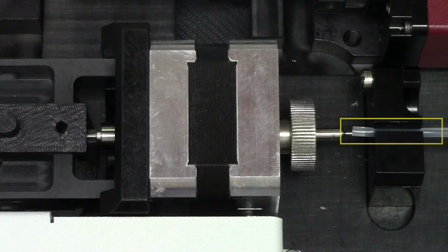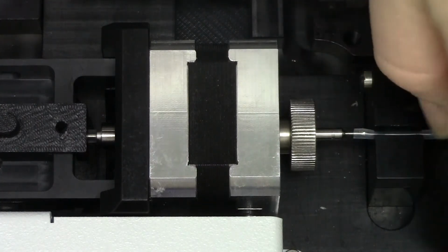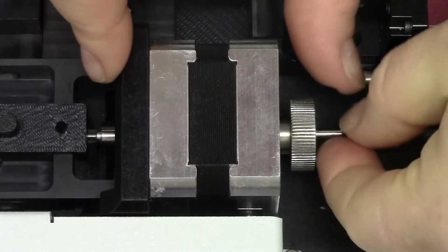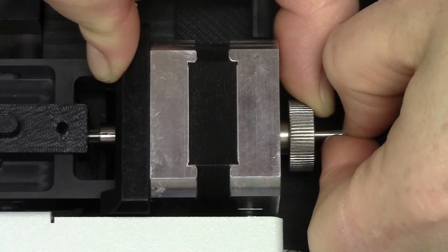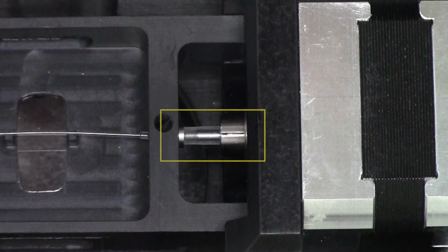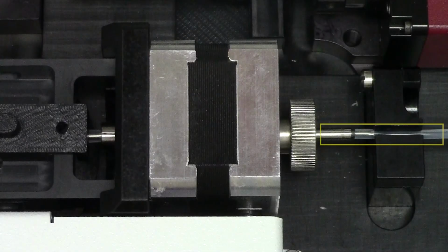Reconnect the sample tubing to both ends of the feeder tubes. Position the sample tubing in the stabilizing arm and carefully slide the end of the tubing onto the metal feeder tube as you lower it. After the sample tubing is connected, gently pull the feeder tube away from the center of the capillary, slightly stretching the silicon tubing between the feeder tube and collar. Adjust the tubing so that it produces a straight pathway sitting snugly in the channel of the stabilizing arm.